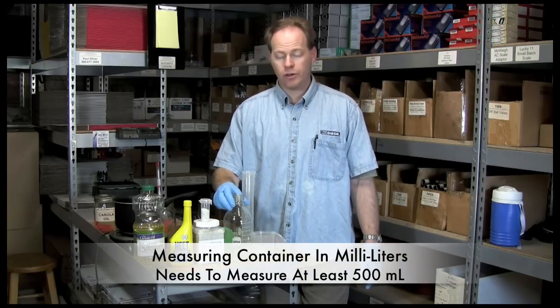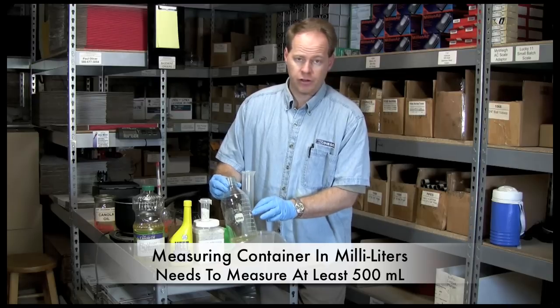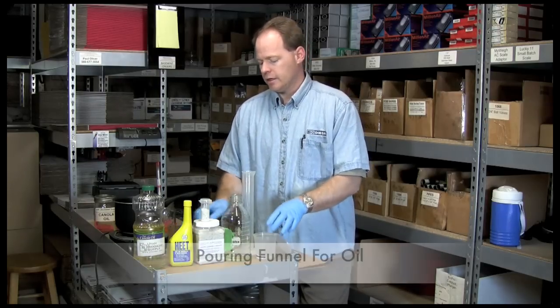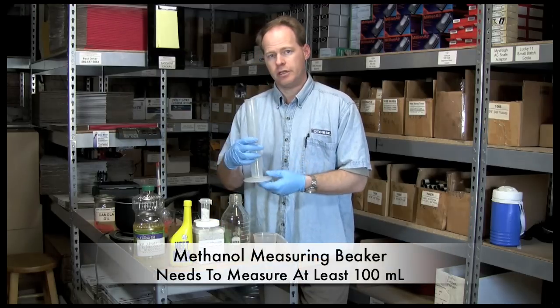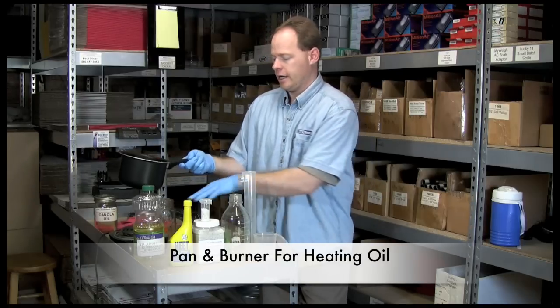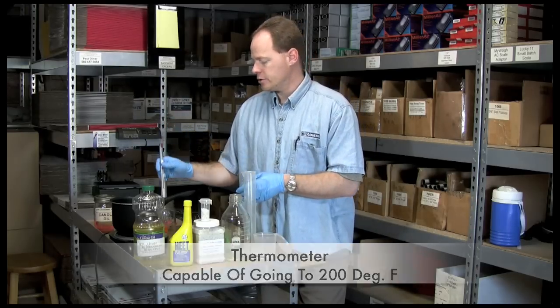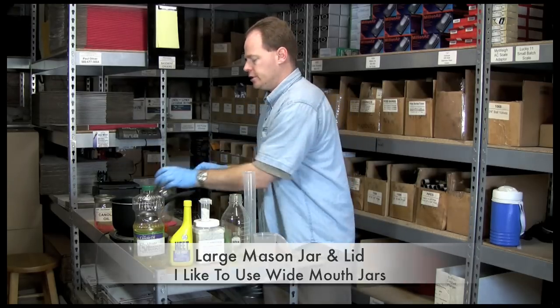You'll need something to measure out your oil with — this goes up to a liter. We're going to measure a 500 milliliter batch today. Something to measure out your catalyst with — this is a cup and a scale, which we'll use. A funnel to pour the oil in with, and then something to measure the methanol and put the catalyst in. You'll need a pan to heat the oil with, and I've got a burner down here to heat that. A thermometer to test the temperature of the oil, and then something to mix it all in — we'll be using a jar, just a cheap old mason jar.